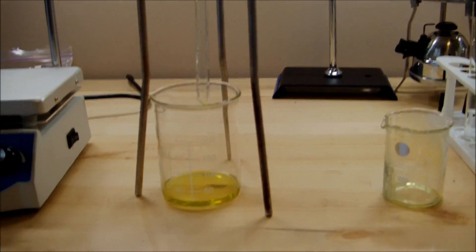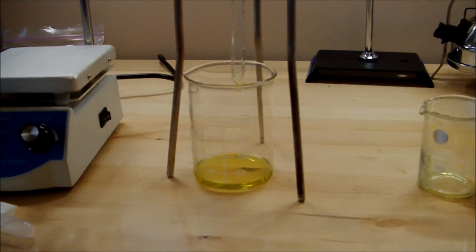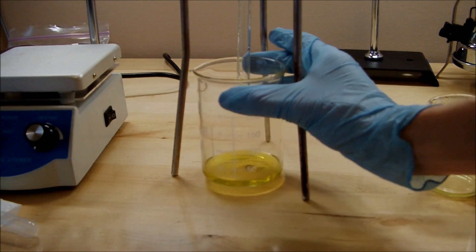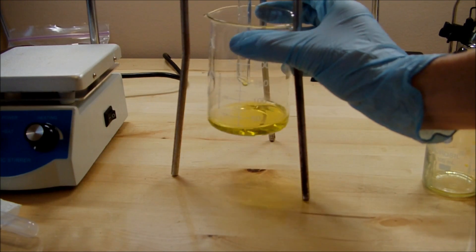Now as you can see, we've got a nice, beautiful lime green solution of iron 2 chloride.